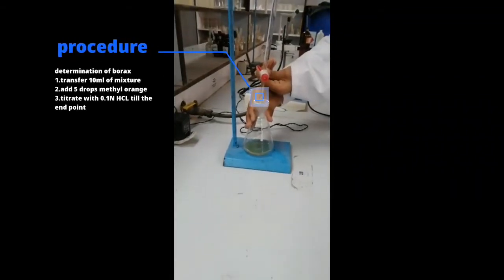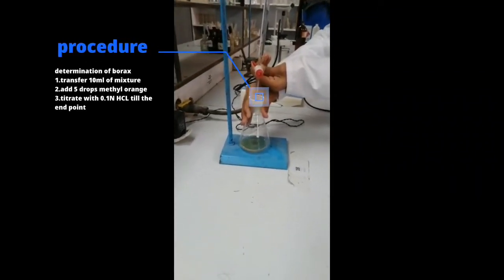Today, we will be covering two titrations, the determination of boric acid and borax mixture.